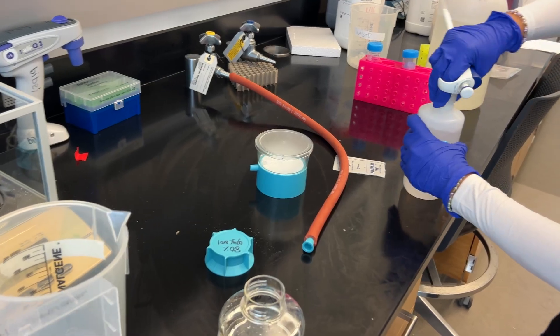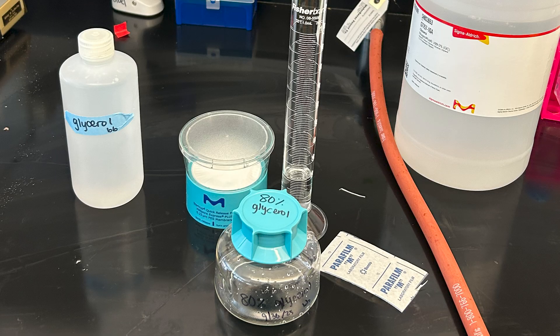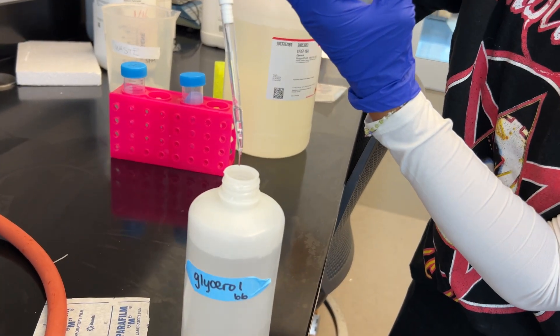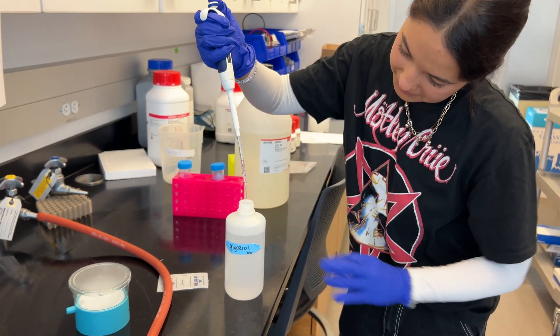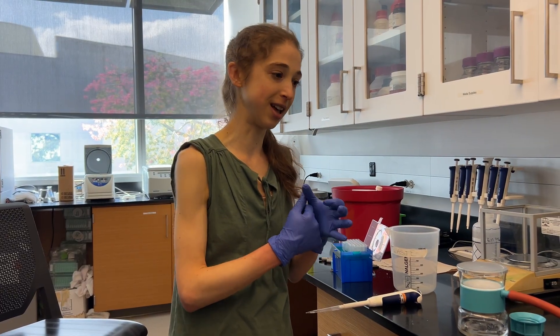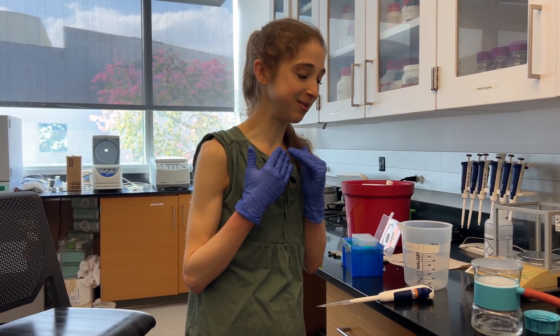Just keep that in mind when you're doing it. By having 80%, we're able to add less than if we were adding 50%, and we avoid having to pipette really viscous glycerol. Some people weigh out glycerol, but then you still have to deal with transferring it. Some people cut pipette tips, but then it still gets stuck and you have to worry about whether that affects the actual volume. So I just go with 80% glycerol, and it works.